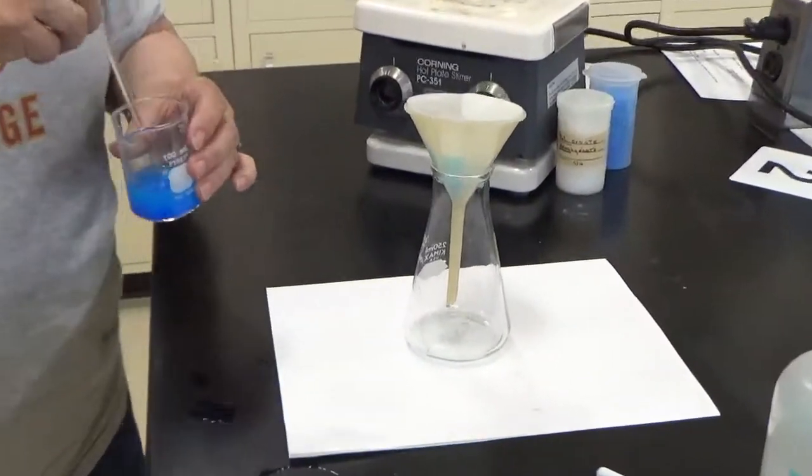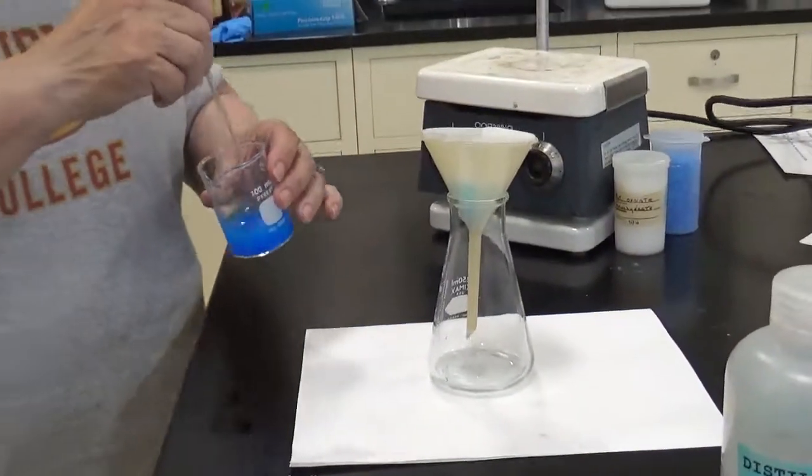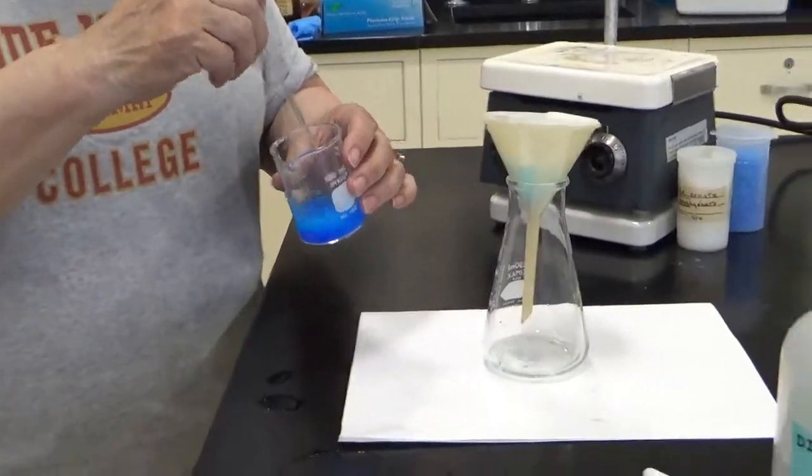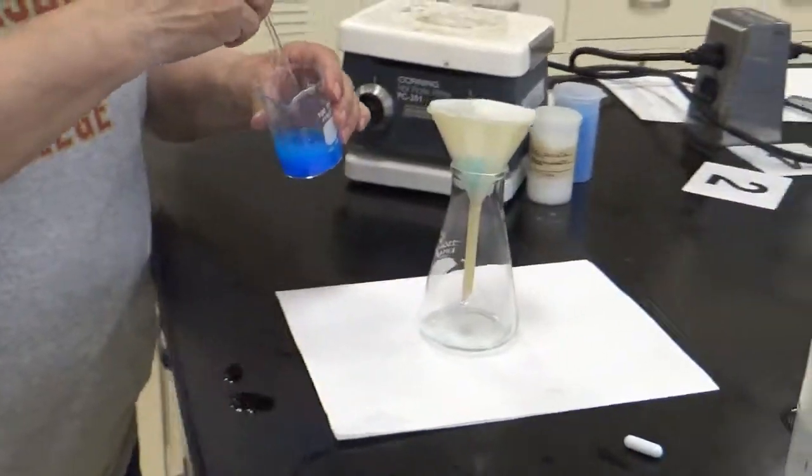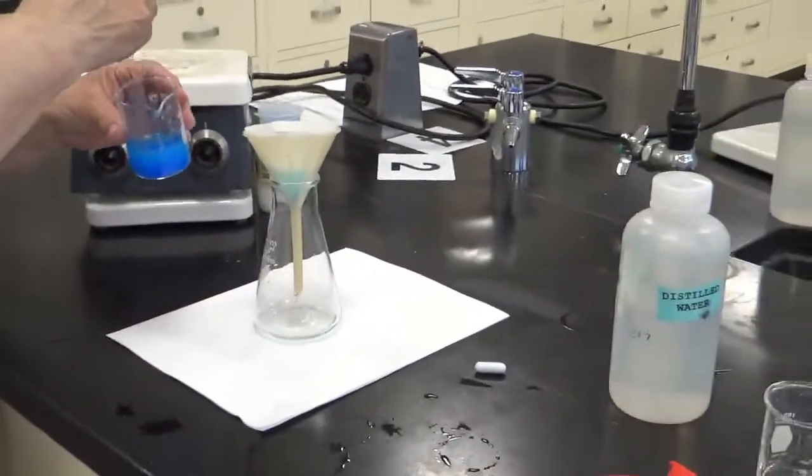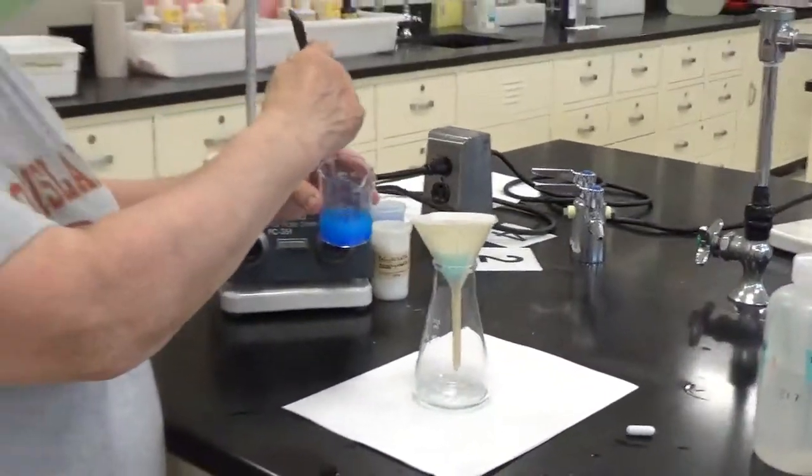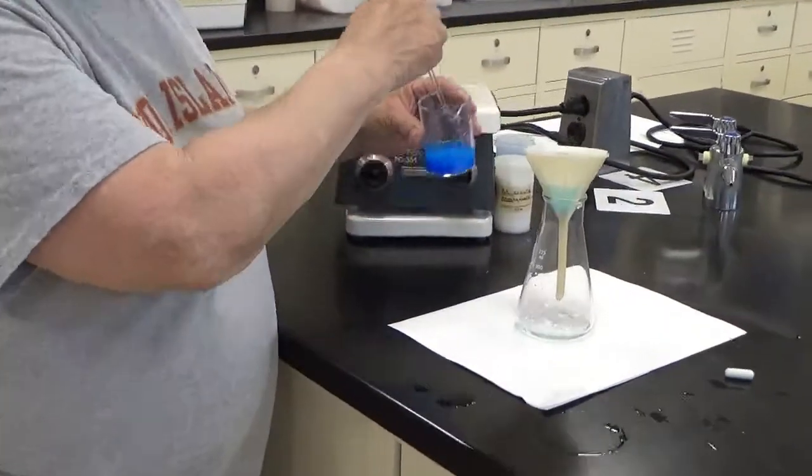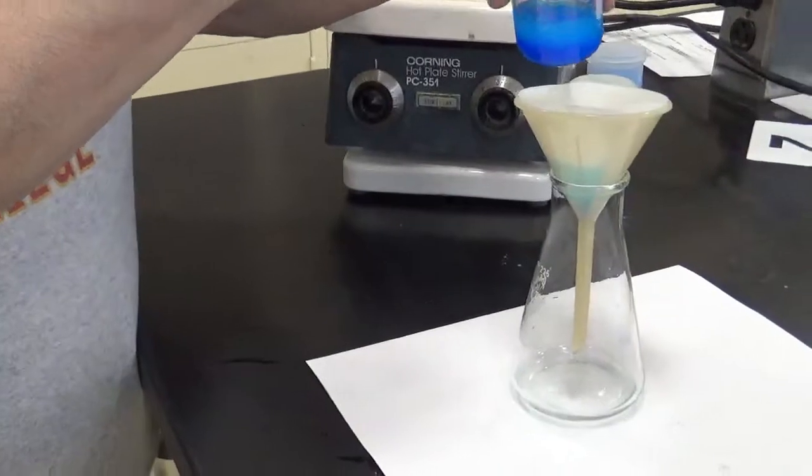Now I have to make a note. Every time you touch a product or a reaction, you're going to lose a little bit of a product. Looks nice, huh? The blue liquid is turning clear.